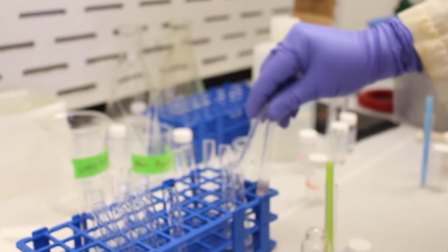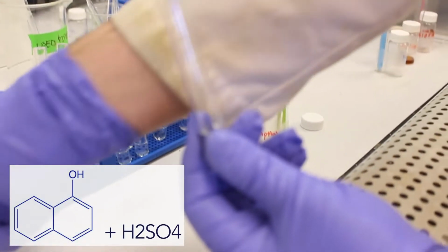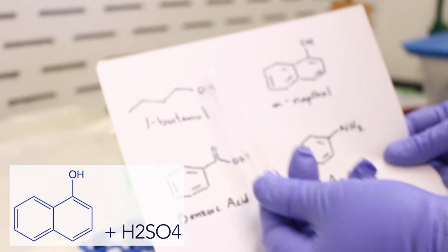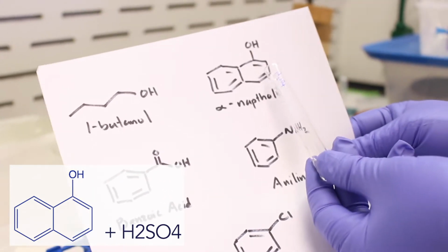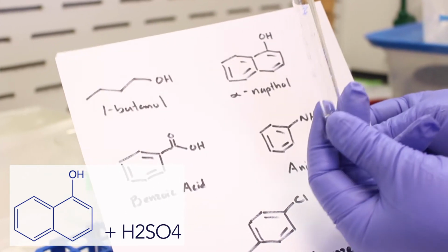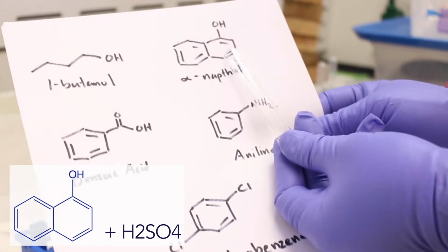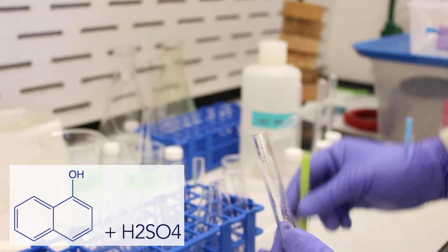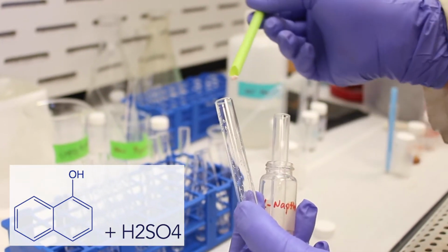Okay. And then for the sake of being thorough, we can test sulfuric acid. So sulfuric acid will solubilize 1-butanol, as we previously discovered, it's neutral. So naphthol will also be solubilized by sulfuric acid because this OH group can actually be protonated by a concentrated acid, such as sulfuric acid. But another reaction that could actually take place is that a sulfate group actually gets attached to this ring, which is something you'll learn about in the lecture. So we expect this to be soluble in sulfuric acid.